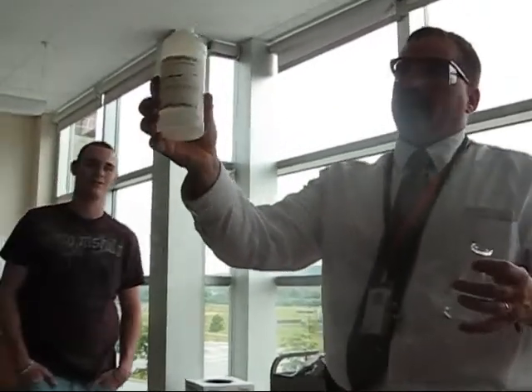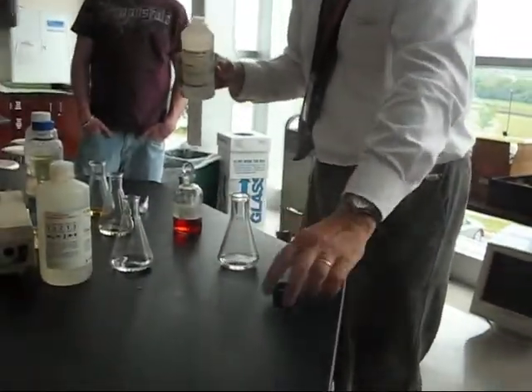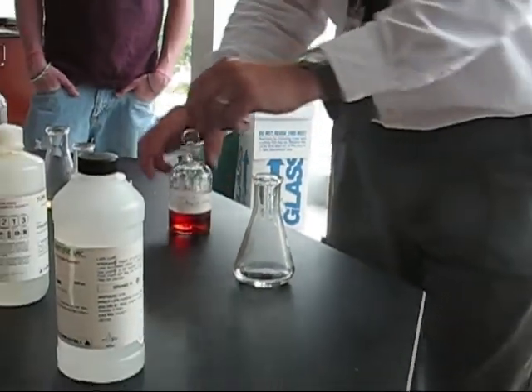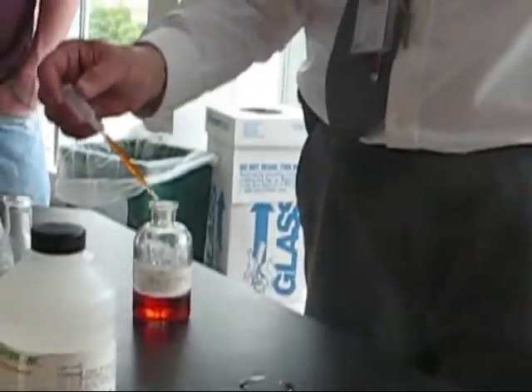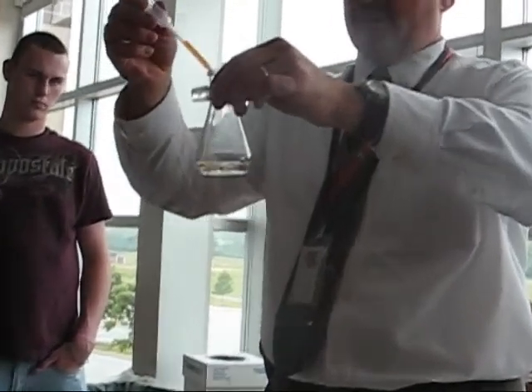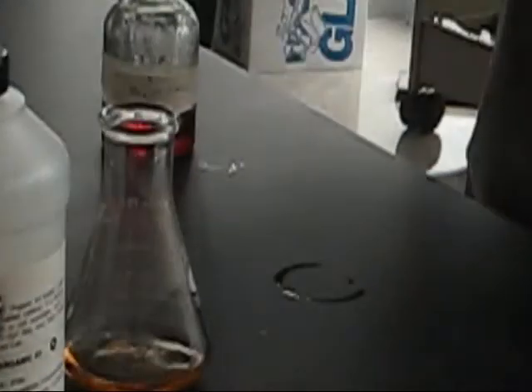This is a compound that has all carbon-carbon single bonds. Okay? It's called cyclohexane. All carbon-carbon single bonds, so every carbon is tetrahedral in shape around it. This will detect, notice the fuming? Some of us might have noticed the fuming. This will detect whether or not there's any double bonds here. If there's double bonds, this color goes away. And you can see the color is still there. Okay, put that back on.